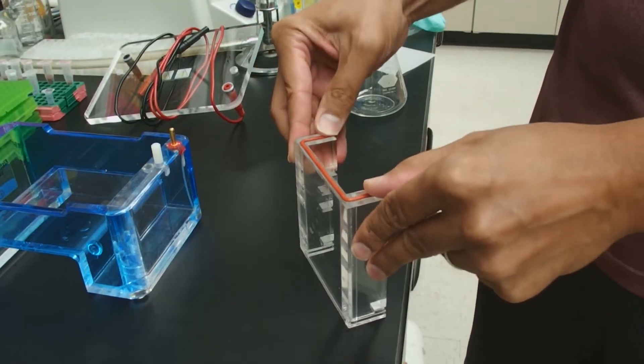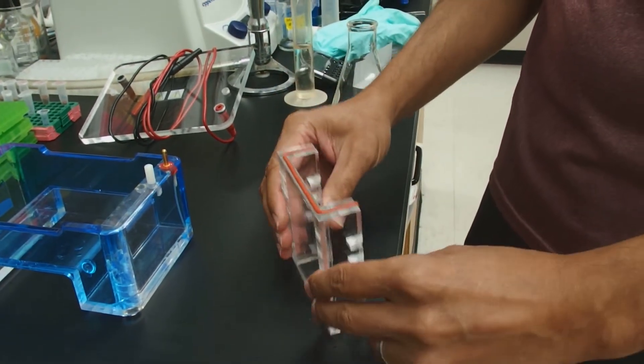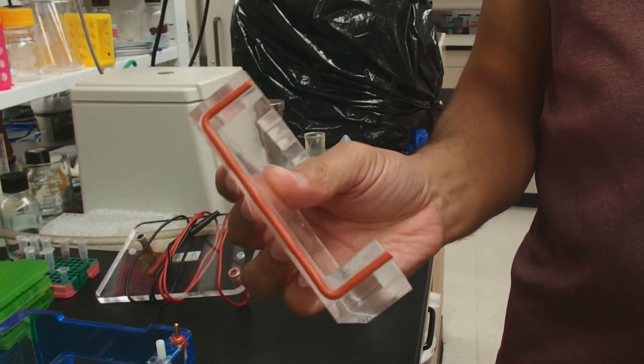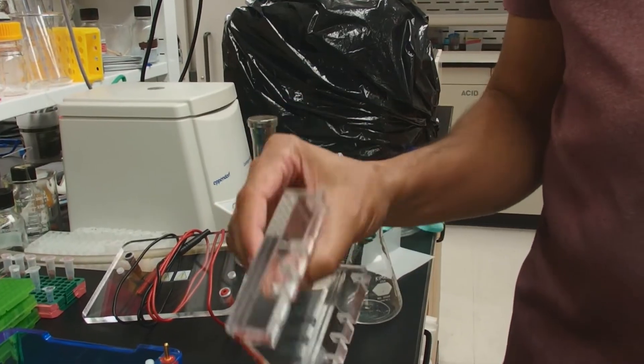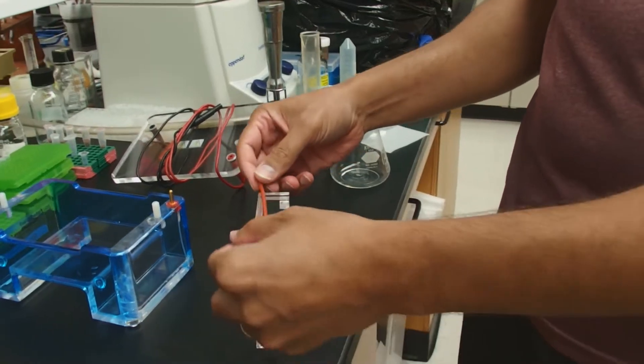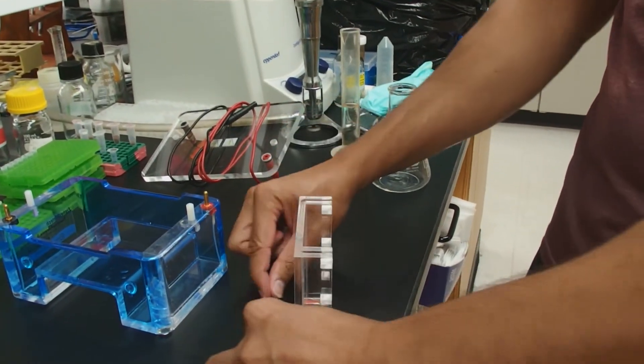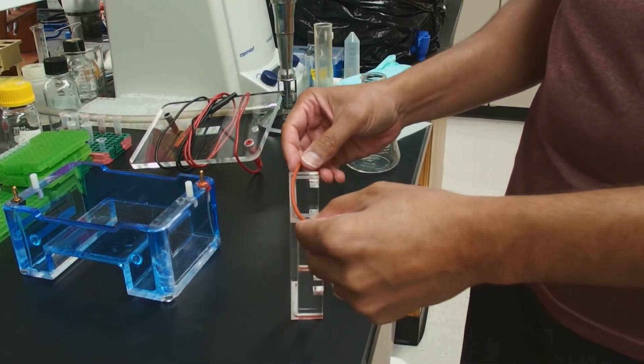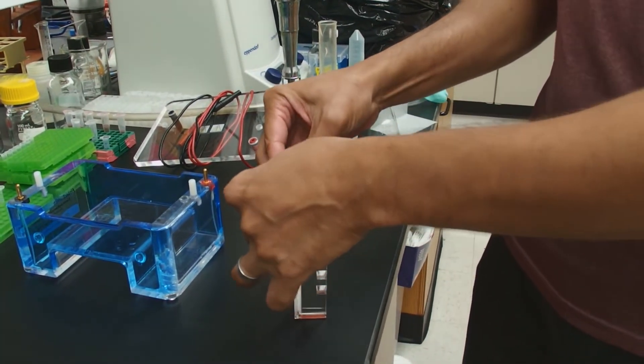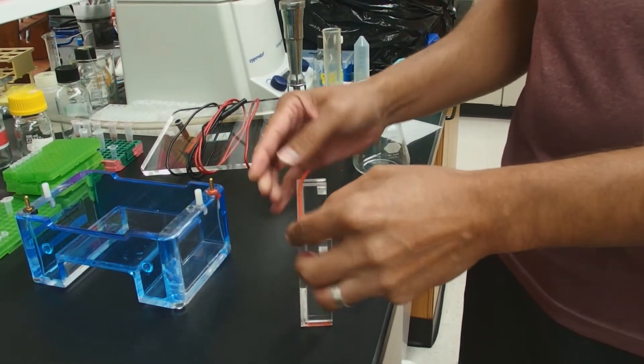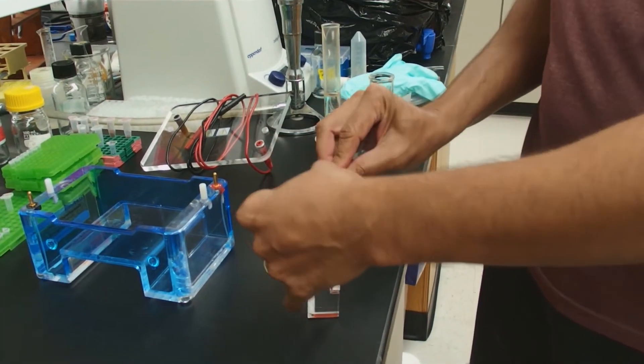If you're lucky, this gasket will stay in place and you won't have to do this. Can you show it to me? How it looks? Can you show the side? So it looks like that. And again, on the other side, put this so it's equidistant from both sides. You don't have to be exact. Get it in the ballpark.